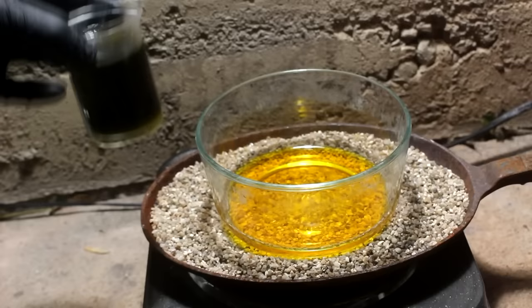Oh yeah — look how shiny! I hope you can see it on the camera, it looks like it's got glitter. Well, it doesn't look like I really need the sodium hydroxide. I'll just let this continue and then we should have some gold. Seems like the reaction has stopped, so now I'm going to pour off the liquid into this other tall glass so I can let it finish settling. There's my gold sponge.